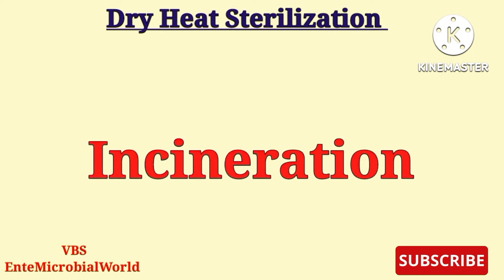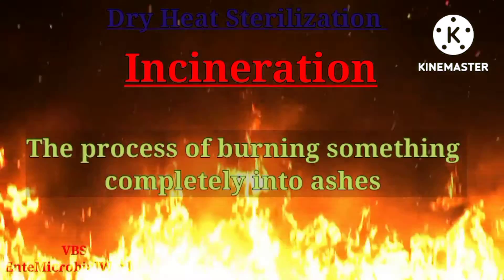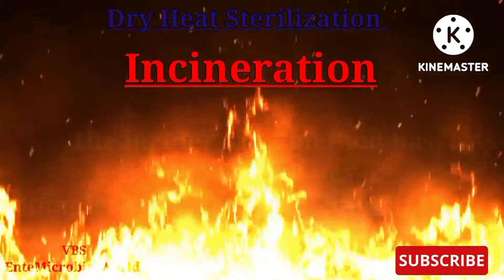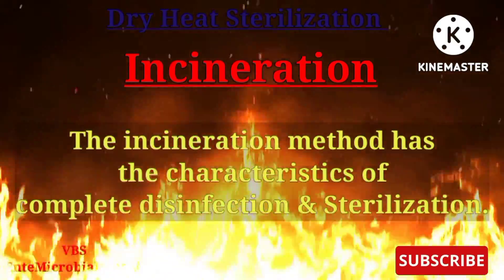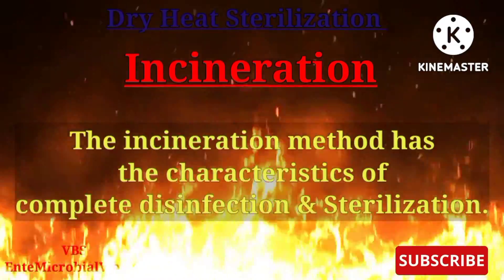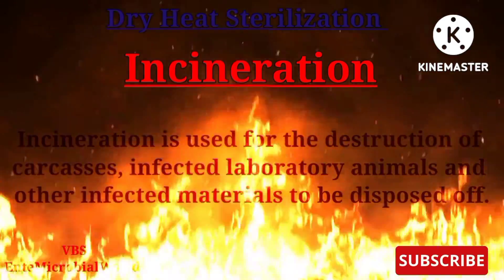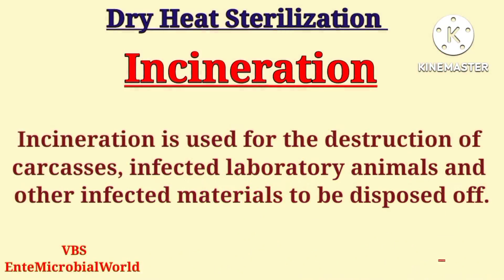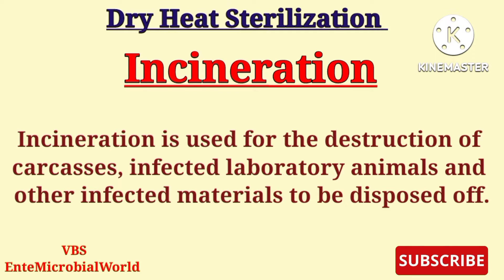Next, we are going to see about incineration. Incineration is the process of burning something completely into ashes. The incineration method has the characteristics of complete disinfection and sterilization.